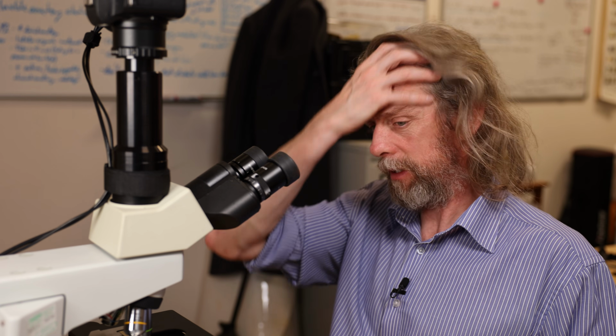So I guess if we've started down this muscle path, I must have some cardiac muscle somewhere. We will be looking at another muscle next week, I guess.